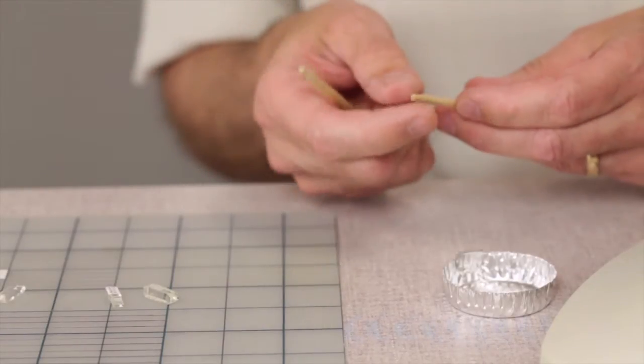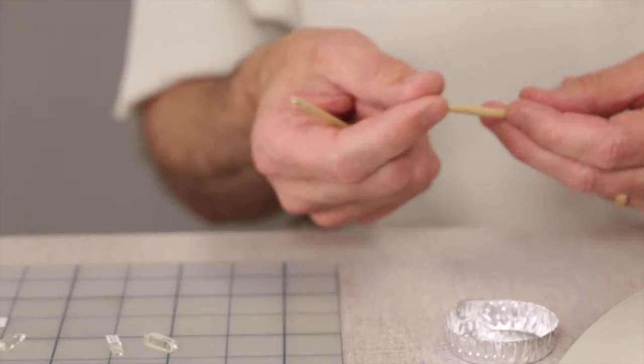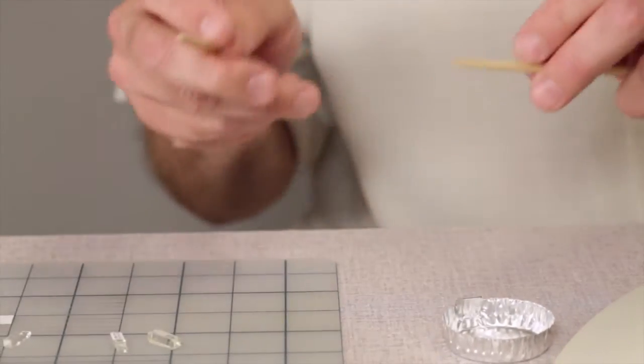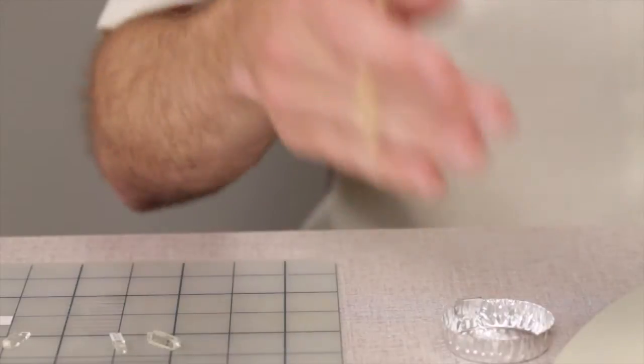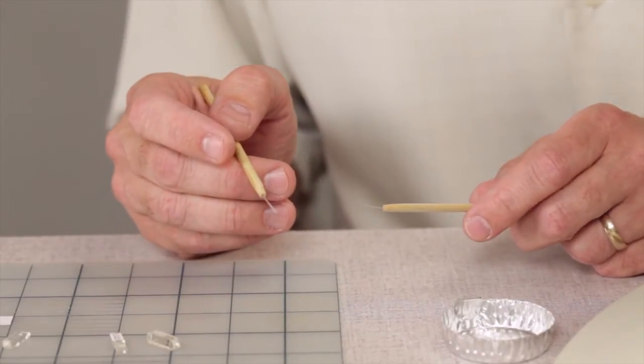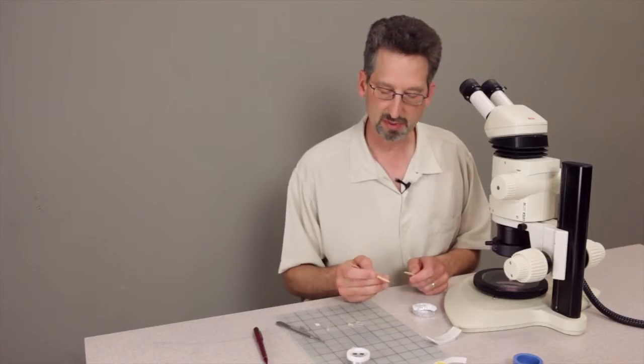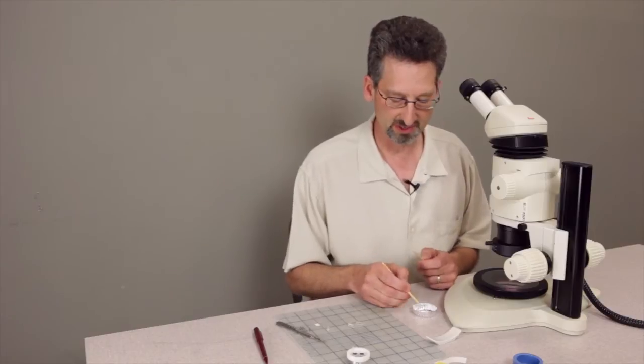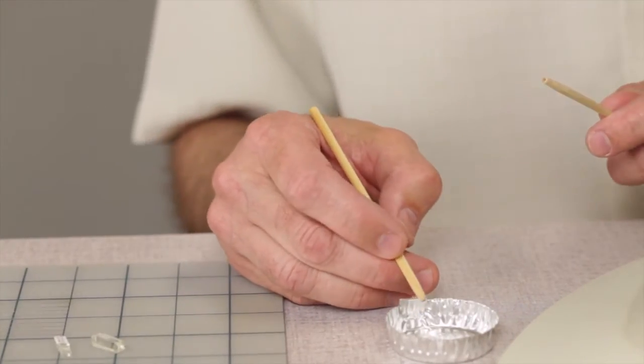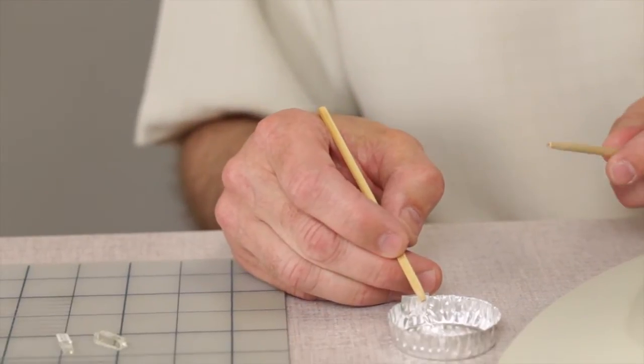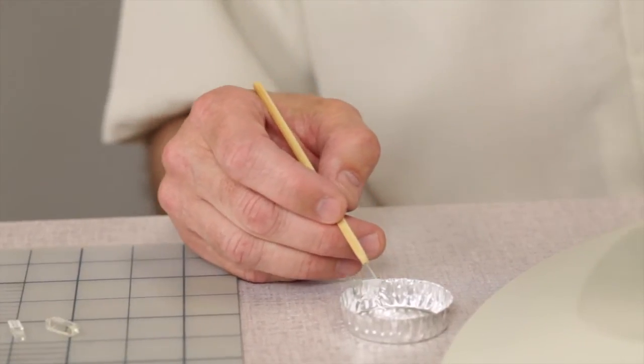We don't want to use a piece of wire or needle because it has a tendency to push that small sample a little too far and maybe right out of our line of sight. So I use about a 15 pound test line for transferring the super glue and about six pound test line for positioning the sample around.